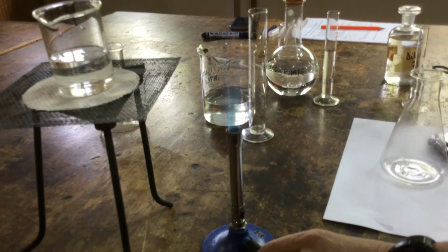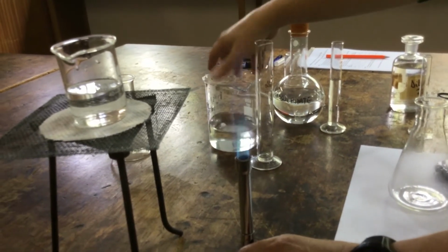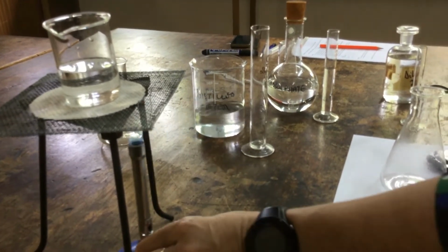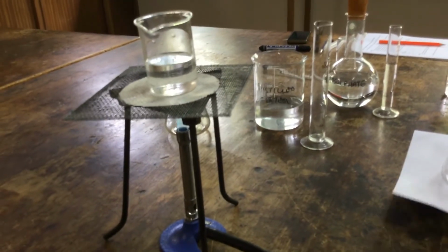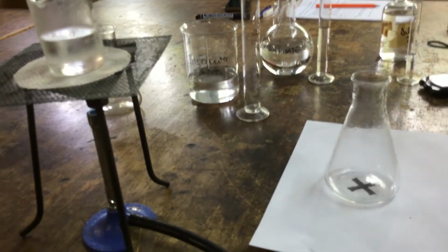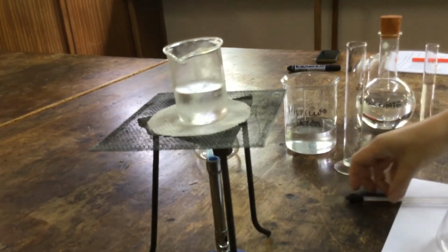Okay, so once again I've mixed 20 cubic centimeters of sodium thiosulfate and 30 cubic centimeters of distilled water, the same. This time we're keeping the concentration the same. And with my hot heating flame, I'm just going to warm up the solution a little bit. Last time the solution was at 23.5 degrees Celsius. We're going to warm it up to maybe in the 30s, and we're going to repeat the experiment at a different temperature.